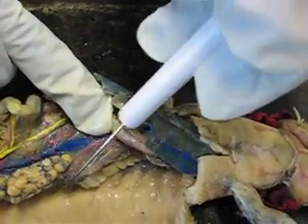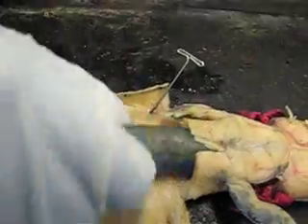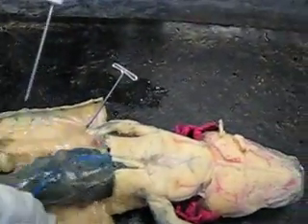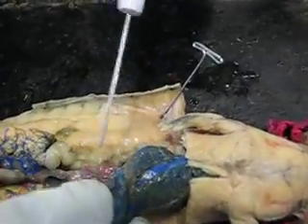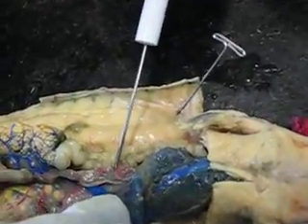Here is the left lung — it's kind of clear. And then the right lung is going to be right here.